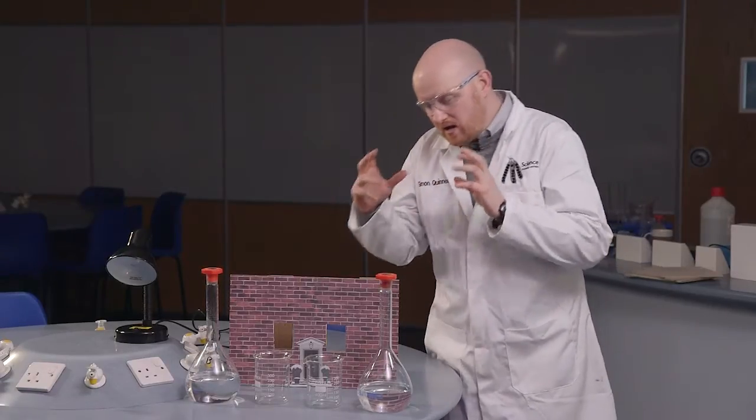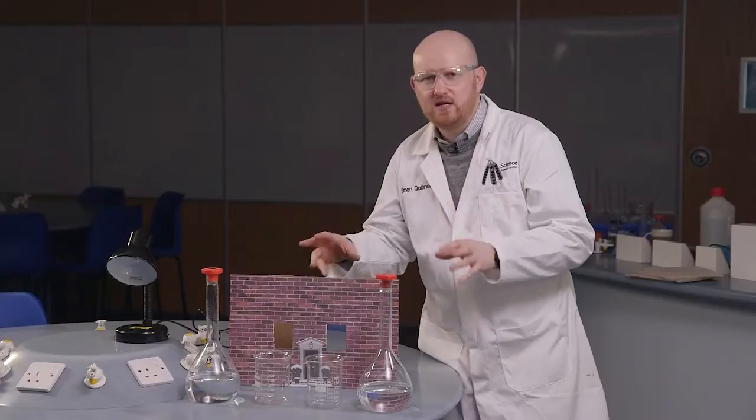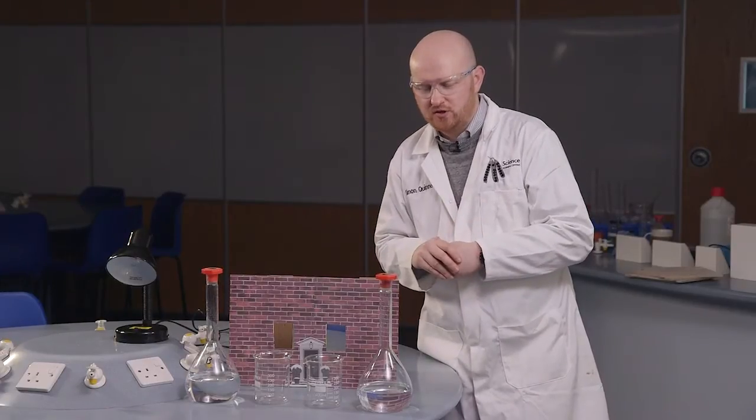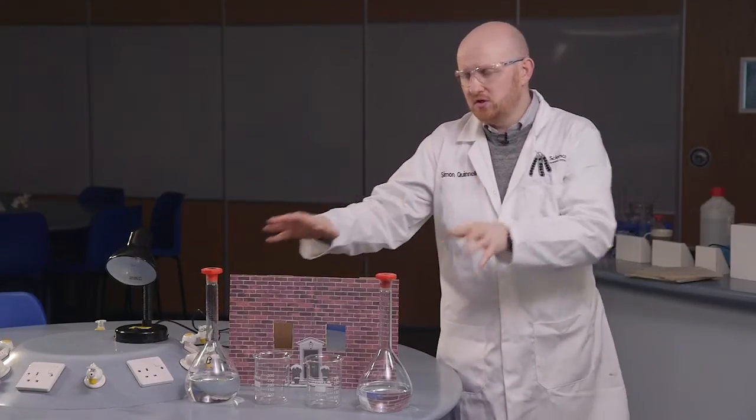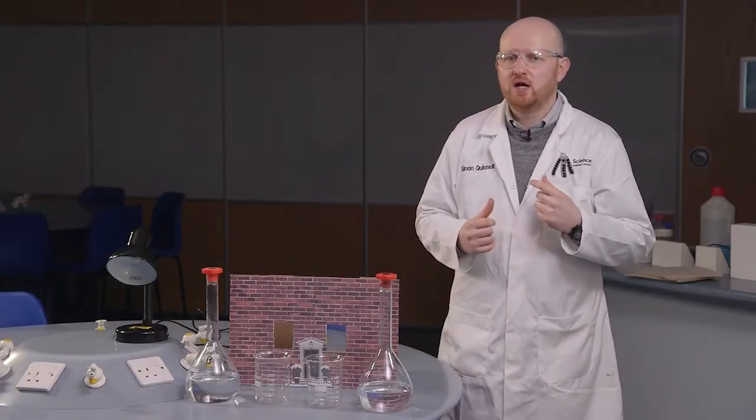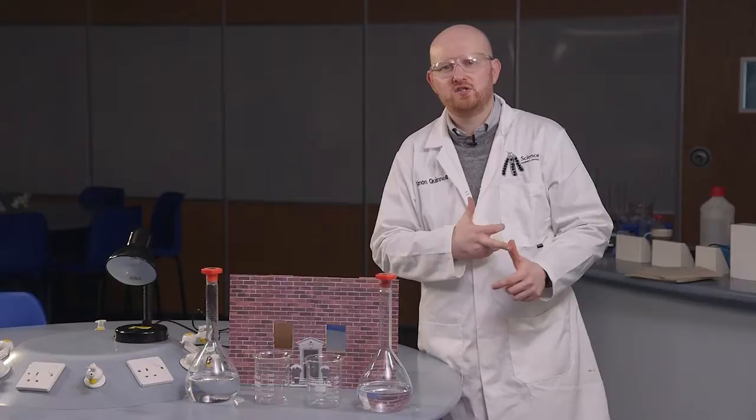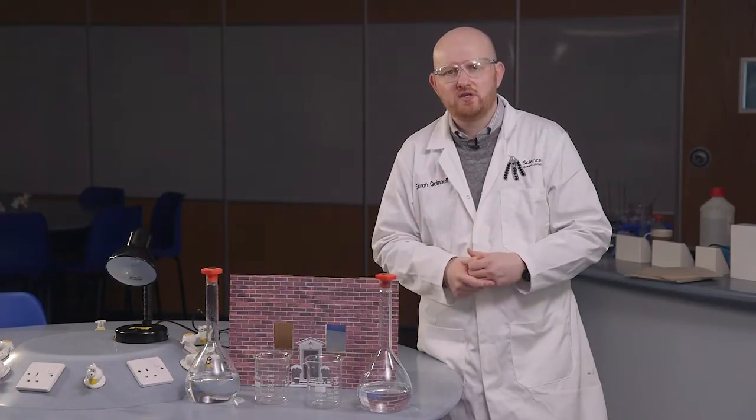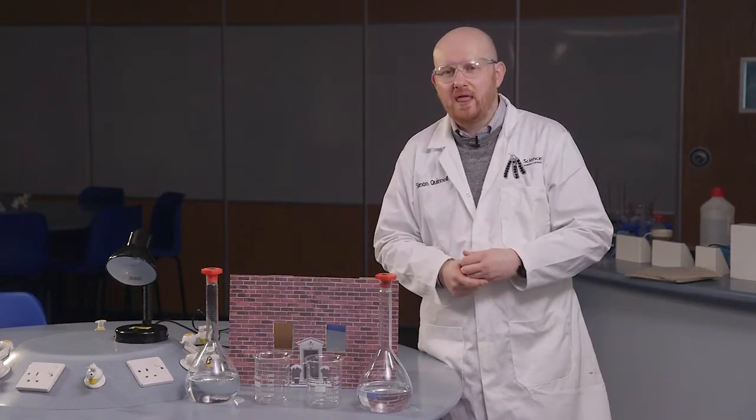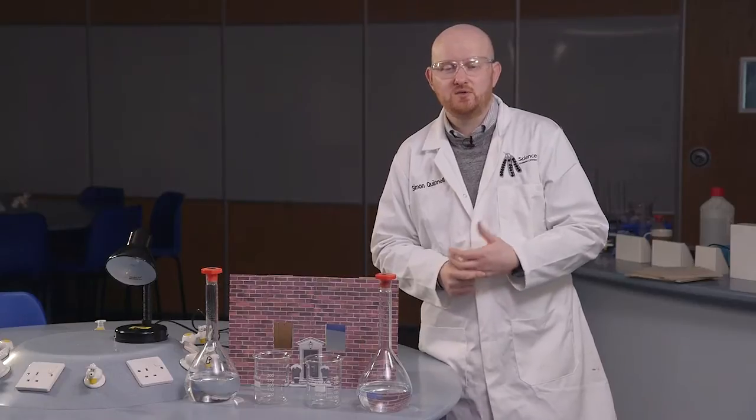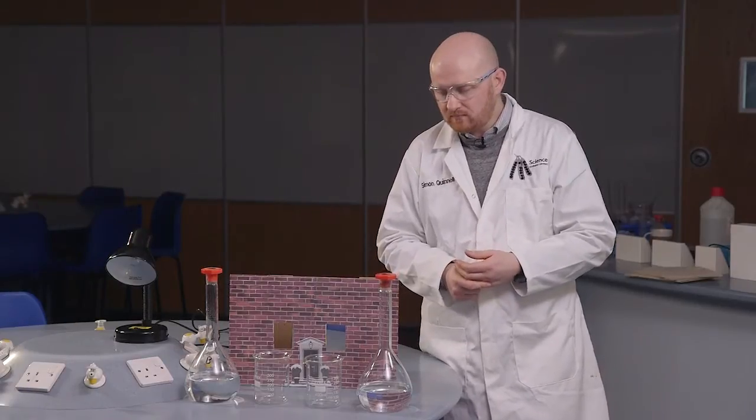Now, the iodine clock is a really nice chemistry demonstration. The recipe for the two solutions we're going to use can be found with CLEAPSS and the Royal Society of Chemistry in their classic demonstrations guide. There's quite a lot of information online and you can find more about it on the National STEM Centre as well.